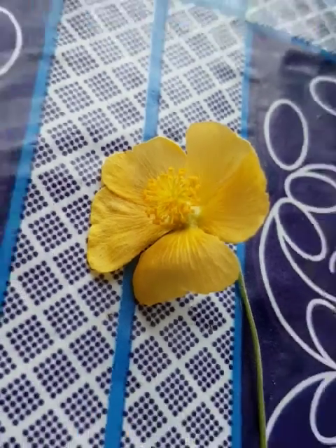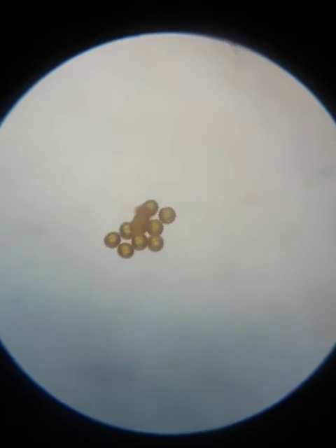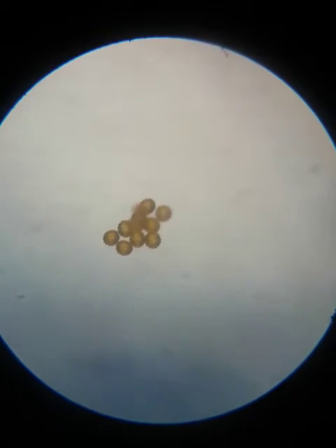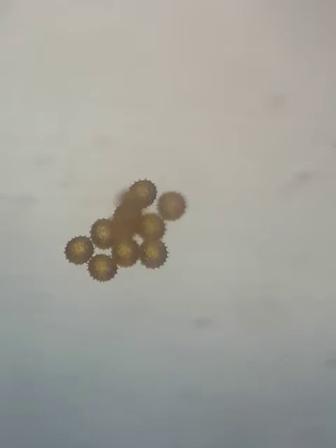So let's go on to the compound microscope. Here it is. You can see spikes on the pollen grains.